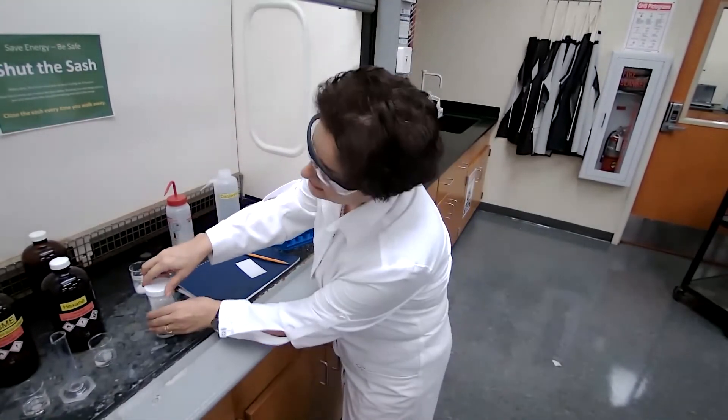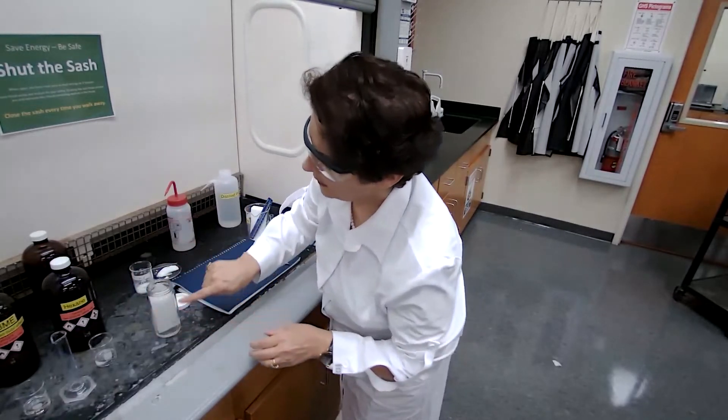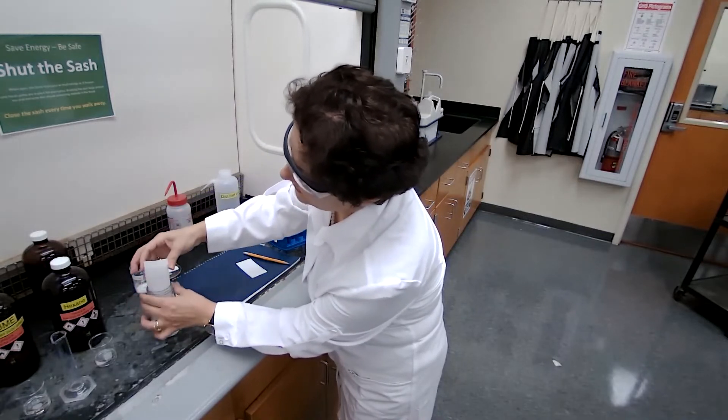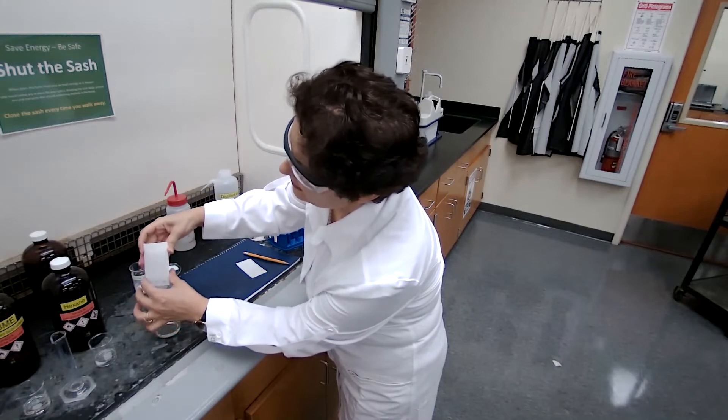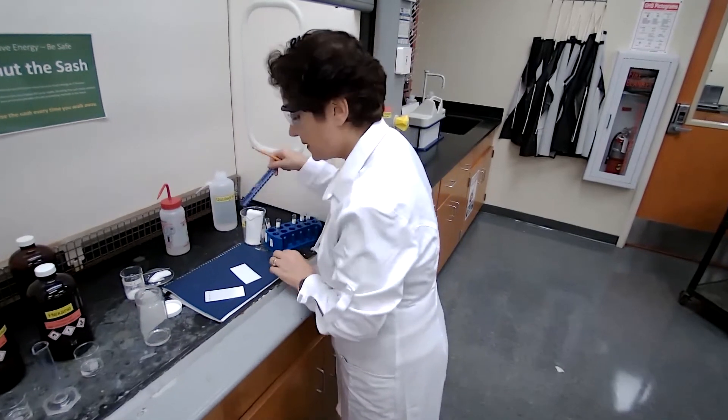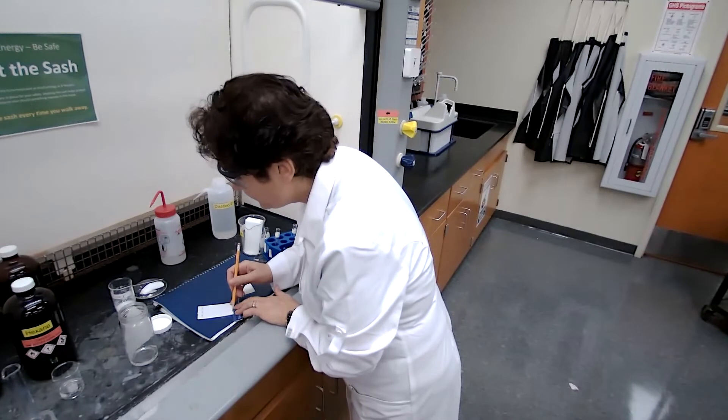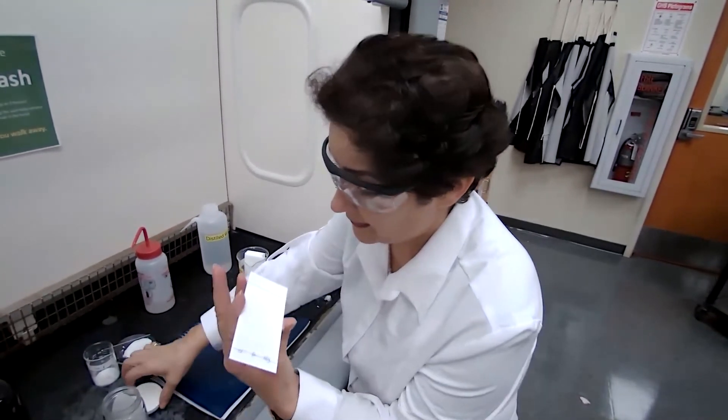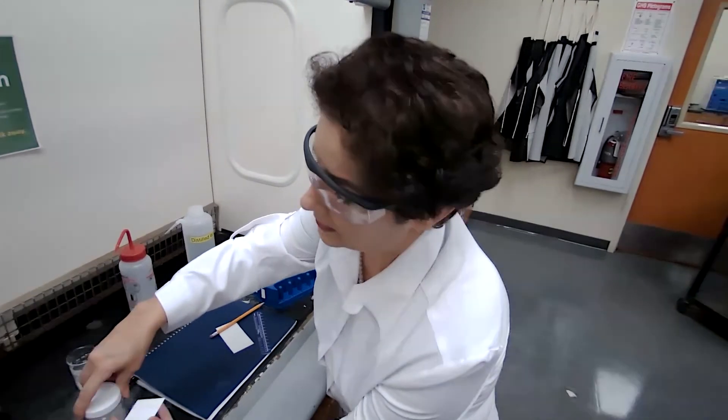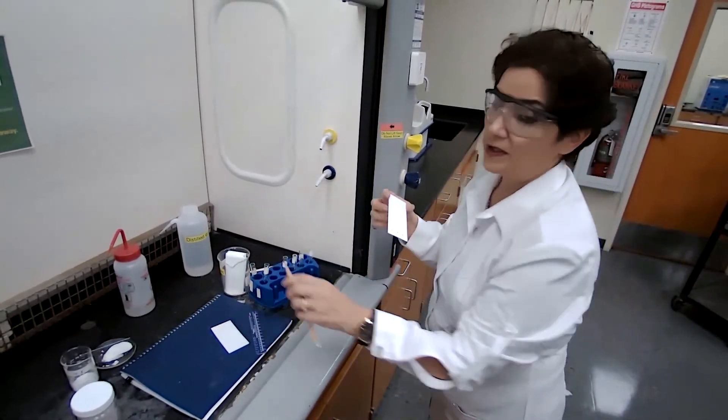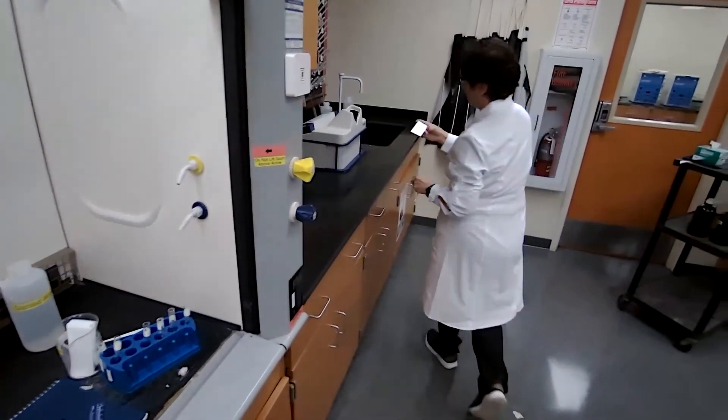Okay. The height of the solvent on the TLC plate, it went up about 80%, about half an inch from the top. We mark that line right away before it dries up. And this one is, this solvent is going to dry up faster. There is no water in there. Almost dry. Going to take it to the UV lamp and we watch it under the UV lamp again.